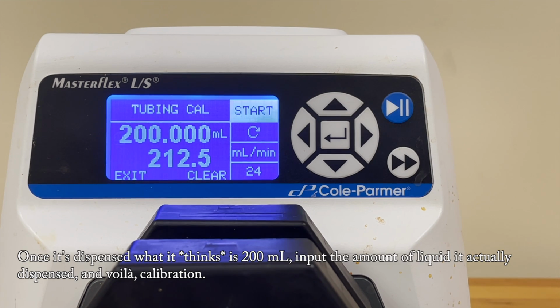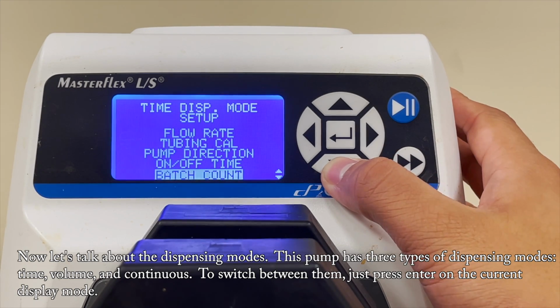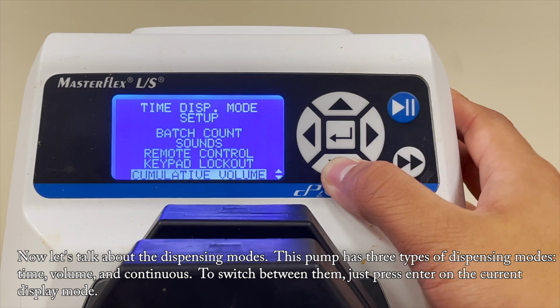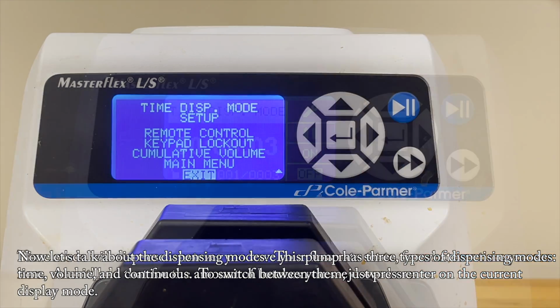Once it's dispensed what it thinks is 200 milliliters, input the amount of liquid it actually dispensed and voila, calibration. Now let's talk about the dispensing modes. This pump has 3 types of dispensing modes: time, volume, and continuous. To switch between them, just press enter on the current display mode.